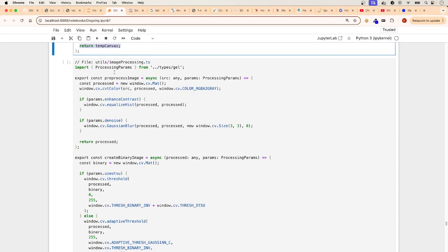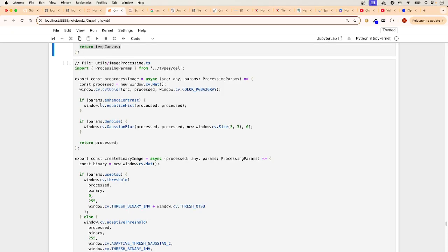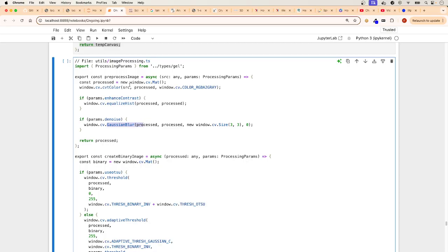Next file, we get into the image processing file, which is this part right here. You have the option to click or not click these three boxes here. If you click, you will enhance the contrast. If you click, you will apply denoising. And if you click, it will use the Otsu thresholding algorithm. Remember from the other tutorials. So that's basically the logic. This is coming from here. When you click, it applies the equalize histogram function from computer vision, OpenCV. If you click denoising, it will apply Gaussian blur. But before it does that, it creates a black and white grayscale image.